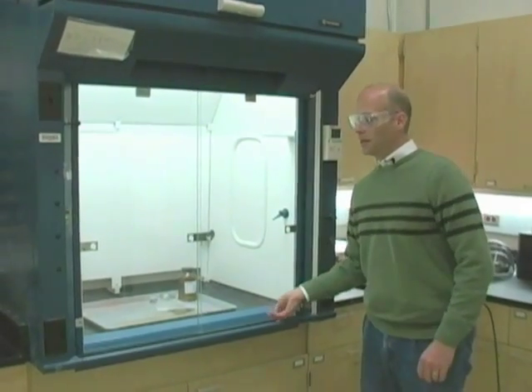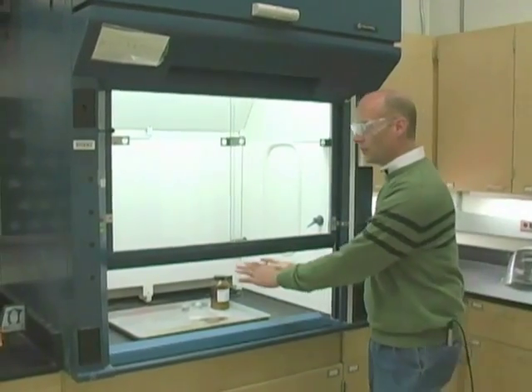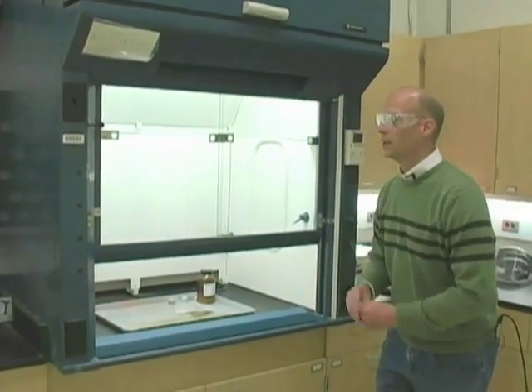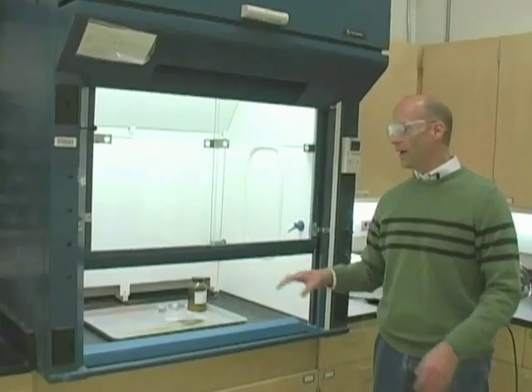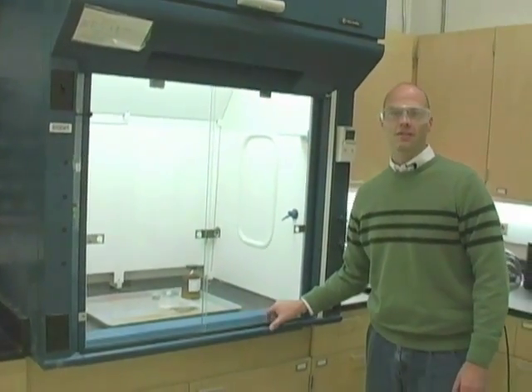Now typically when we work at the fume hood, we will have the sash open so that we can reach inside and work. But then we walk away. If we can close that sash again, there's an opportunity to save as much as 35 percent on the annual energy usage of a fume hood.